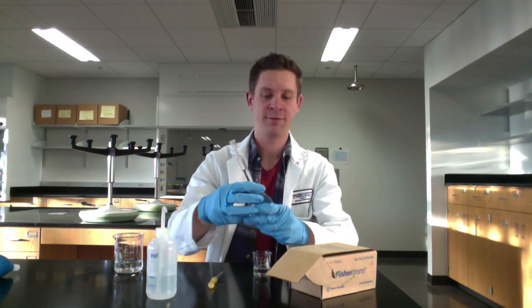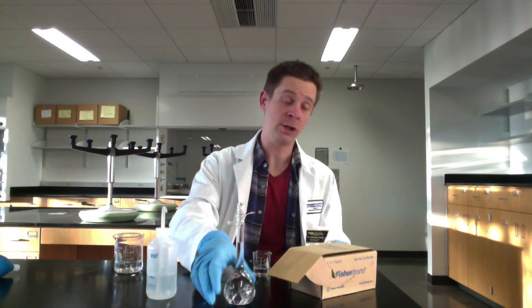And here we have our diluted solution — a 1-to-10 dilution where we took 10 milliliters of 0.1 molar acetic acid and diluted it to a total volume of 100 milliliters. The final concentration is 0.01 moles per liter. It's a straightforward dilution, but all dilutions work on this same principle of starting with some stock and using a volumetric flask to add solvent up to a particular volume.